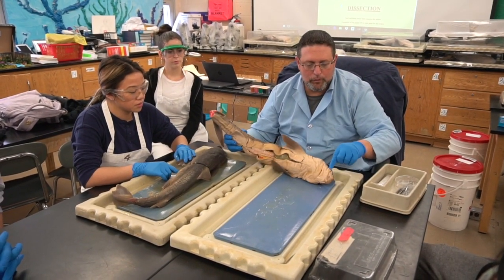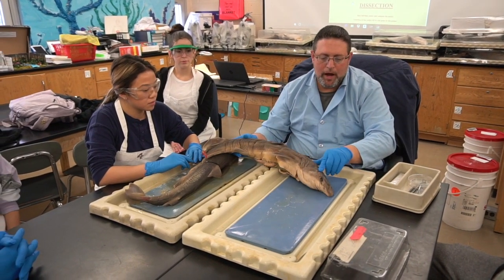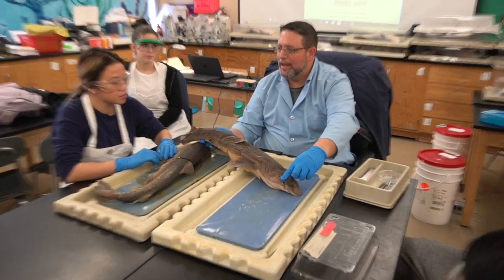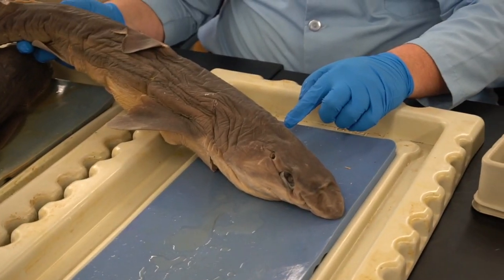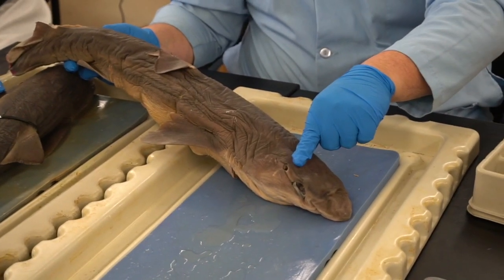Obviously, we saw the eyes, we saw the nostrils on the other side, we see the mouth. Behind the eyes are these two openings on the head. It was the word that started with S. Does anyone remember it without looking? What these organs were, the openings in the top of the head. It's only been one day. I'm not killing you over this. No. Okay. These openings were called spiracles.